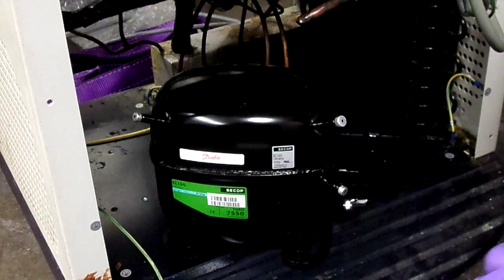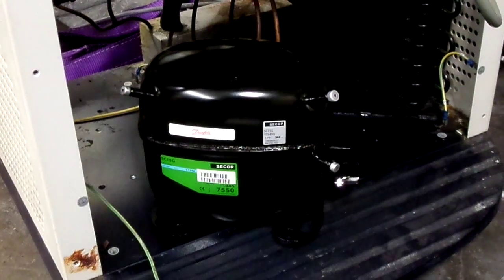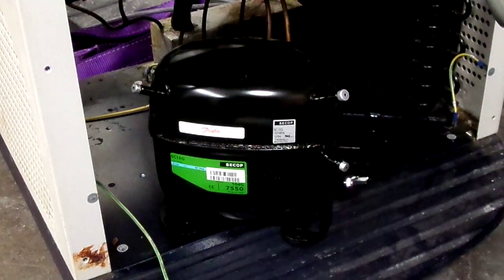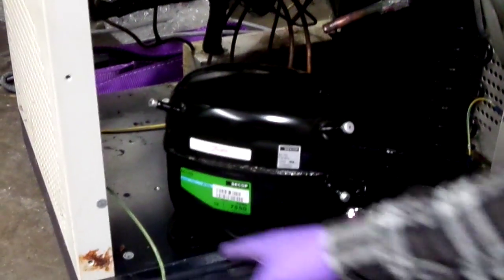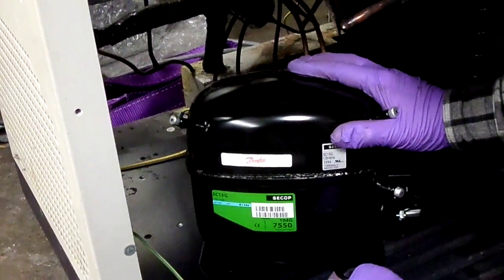To get it in place, grab your rubber feet, match them up with the ones on your old compressor. You want to put them in the same spot. If you can see over there, they're all in these spots. So you can pop these suckers in there.